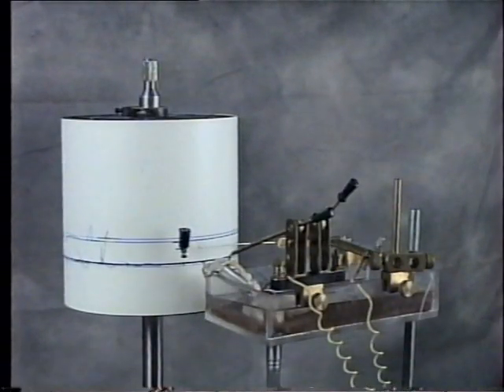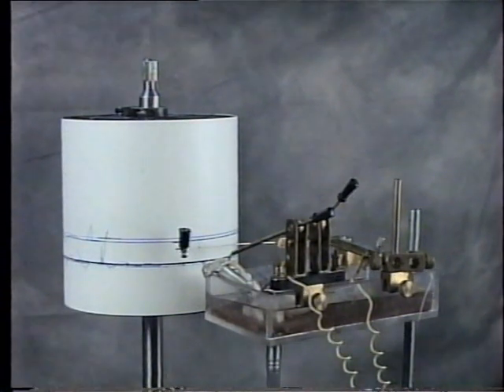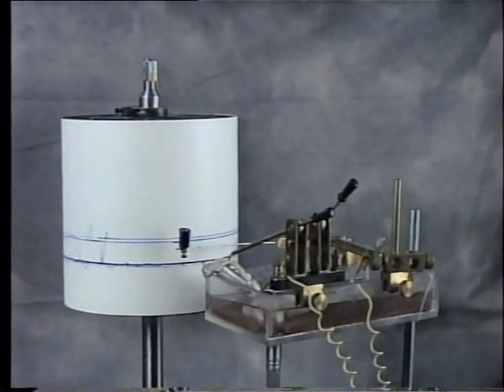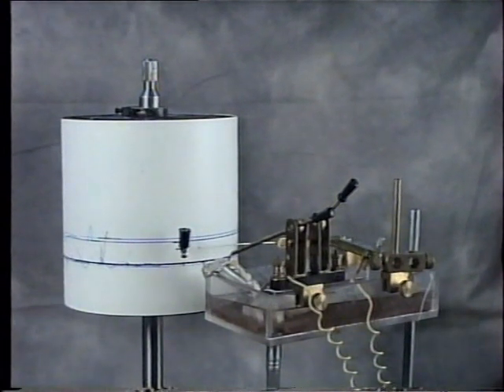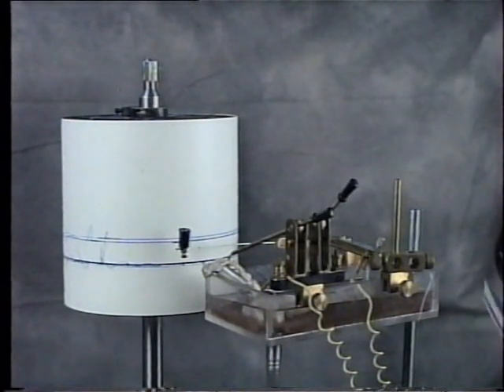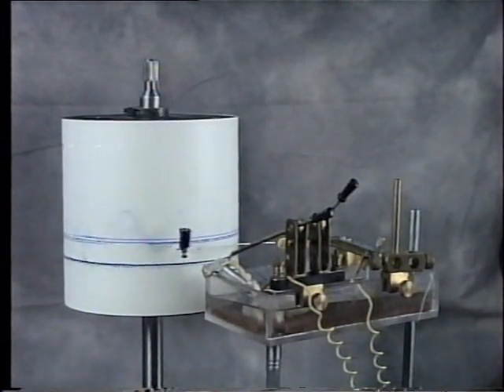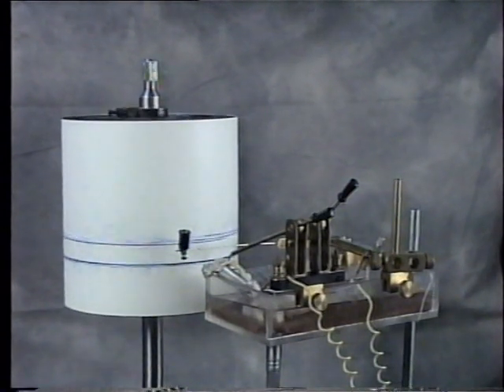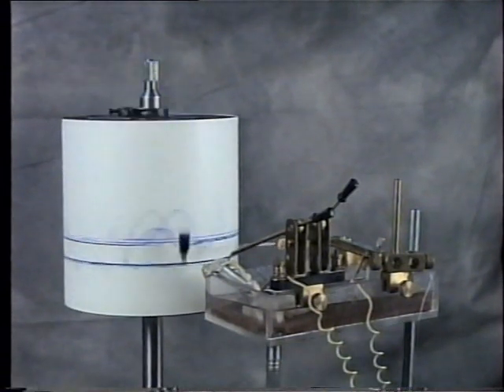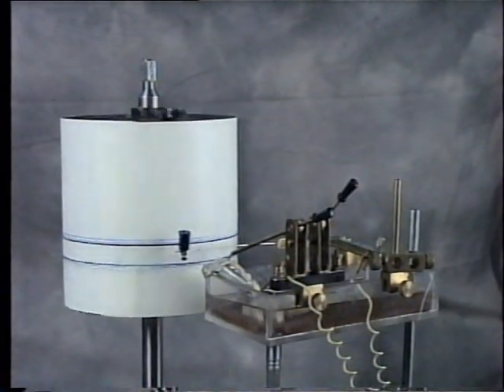This experiment is to show the effect of sustained repetitive stimuli on muscle contraction, that is, fatigue. Arrange the apparatus and the muscle-nerve preparation as for recording the muscle twitch. Set the drum to fast speed, apply the point of the lever on the drum surface, and set the drum in motion. Record the first 3 contractions, leave the 4th to 9th, then record the 10th, 15th, 20th, and 25th contractions.